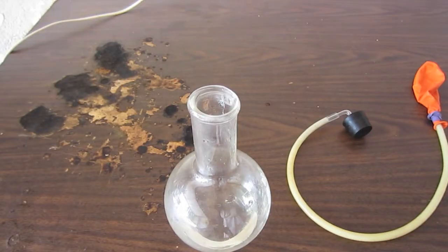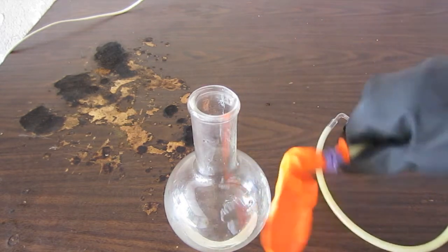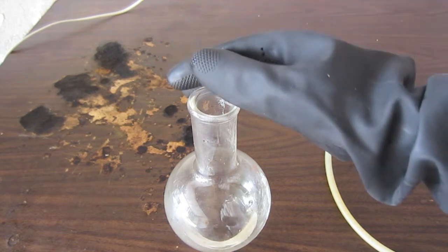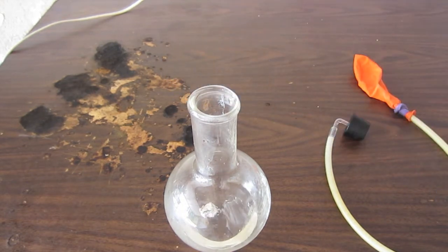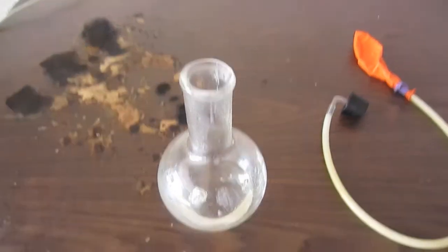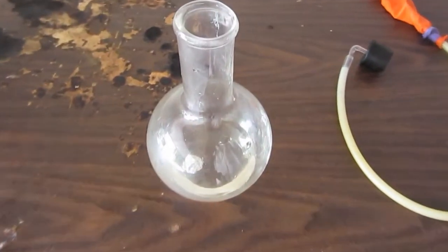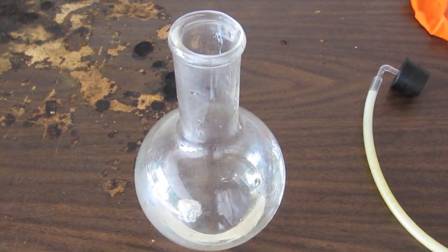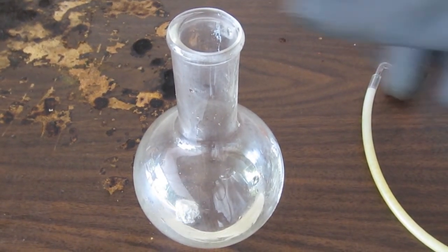Okay, in my previous hydrogen video, I did show hydrogen burning, but I did not show the classic blowing up a balloon filled with hydrogen. So that's what I'm going to do this video. I'm going to start out putting a very small amount of aluminum inside my Florence boiling flask filled with HCl, and we will get, after a while, after it eats through the oxide layer, here you can see the reaction is starting.